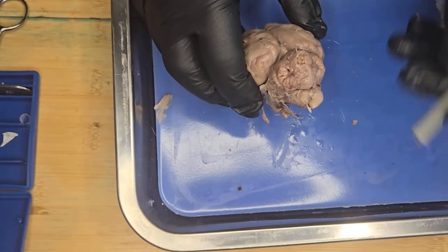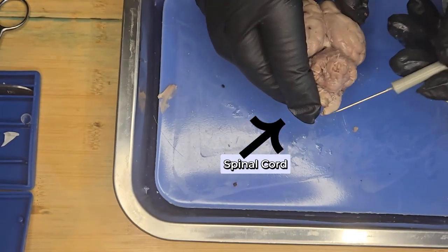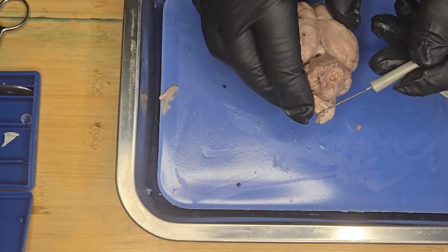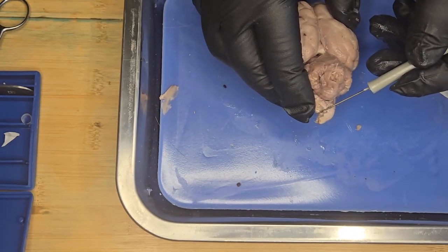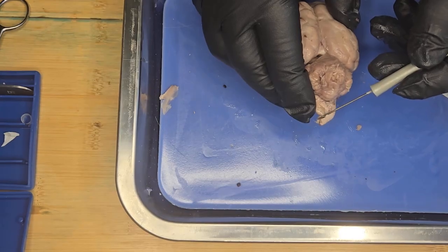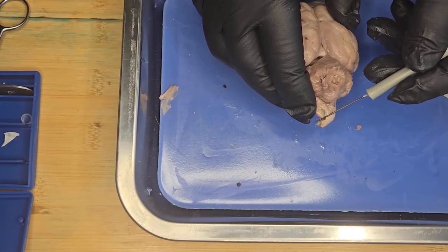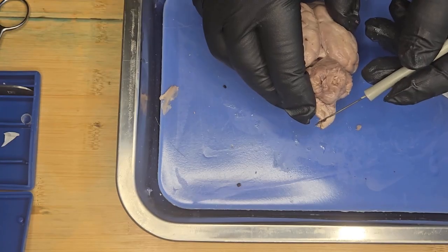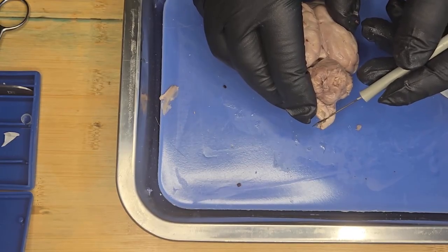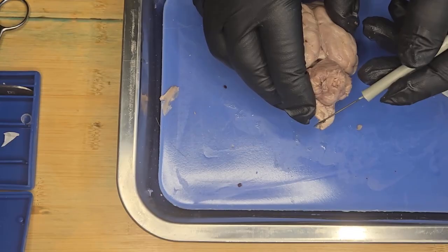You can also see on the external structure the part of the brainstem and what is leading to the spinal cord. And the spinal cord basically is your body's main information highway. It is a long, thin bundle of nerve tissue that runs from the base of the brain all the way down your back. It is divided into several regions, namely the cervical region, which is your neck region, the thoracic region or the upper back, the lumbar or lower back region, and the sacral region, also in your pelvic region.